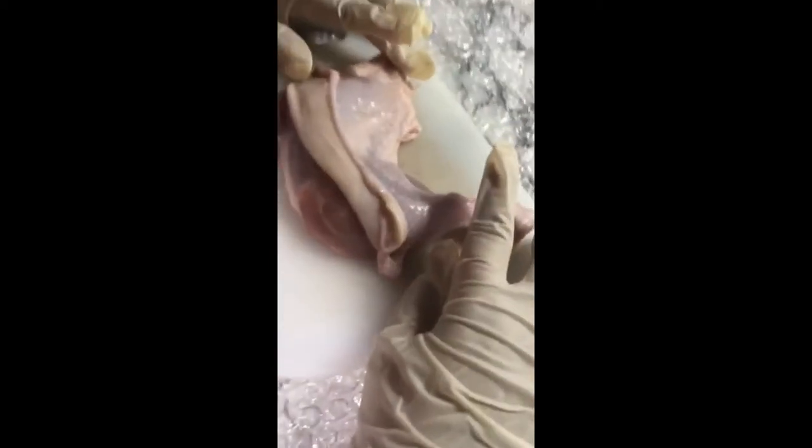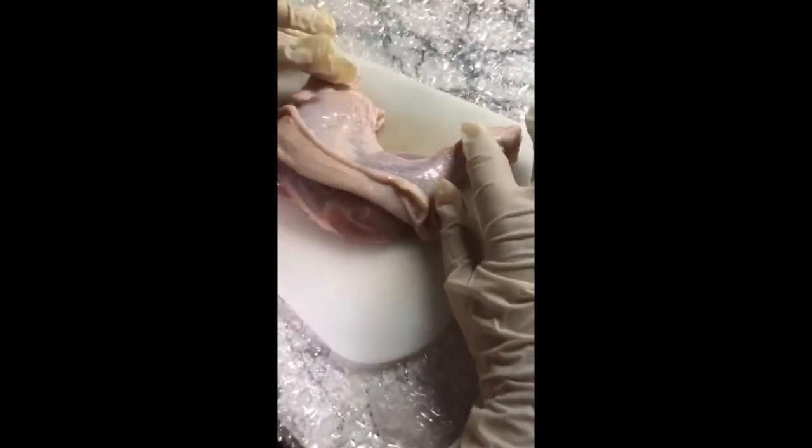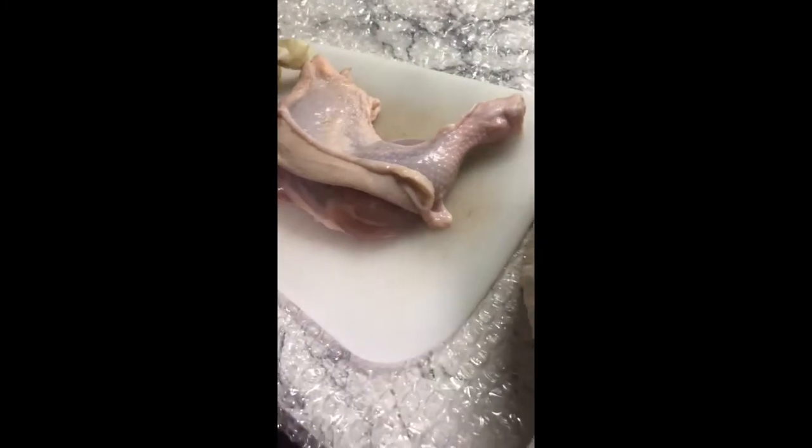Hi guys, my name is Daniel McKay Guerrero and today we're going to dissect a chicken leg. We're going to compare the structures we have seen in the chicken leg to the structures in our very own body.